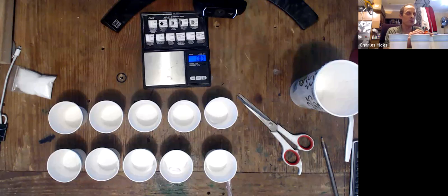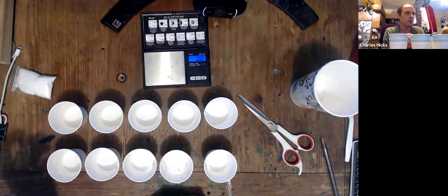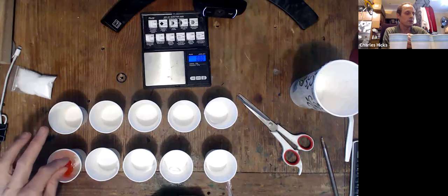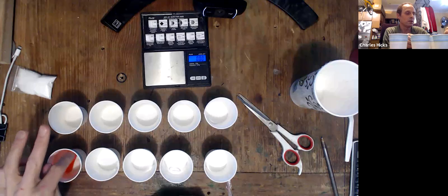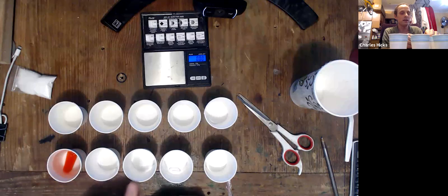So once you have your 10 standard solutions prepared, and you have 10 Gatorade baggies, you're going to put each one into a different percent sucrose. And you can push it to make sure it goes underneath the surface. Set up 10 of those and start your timer for one hour.